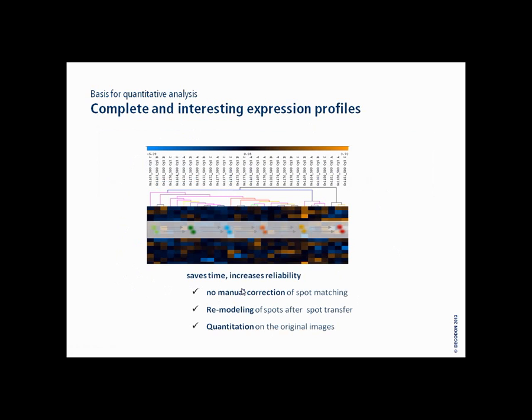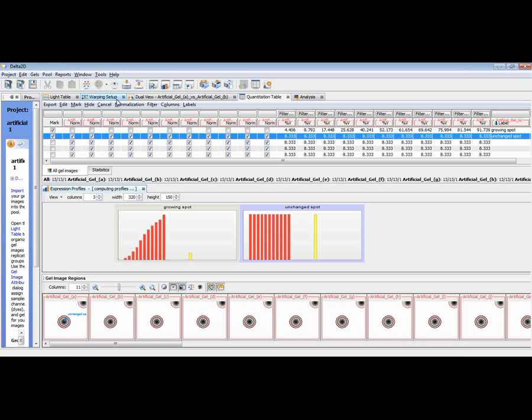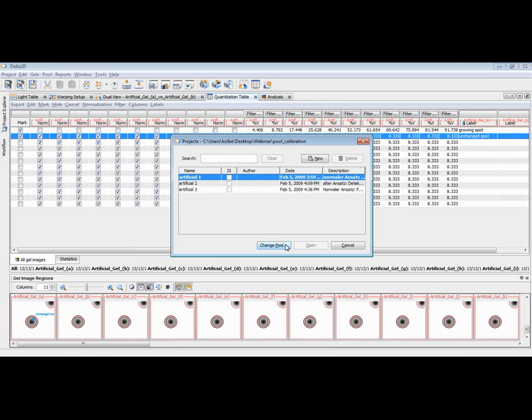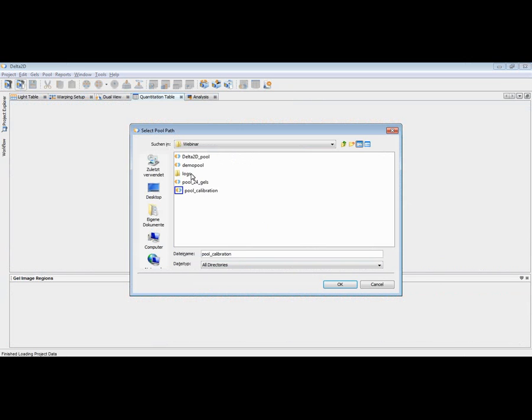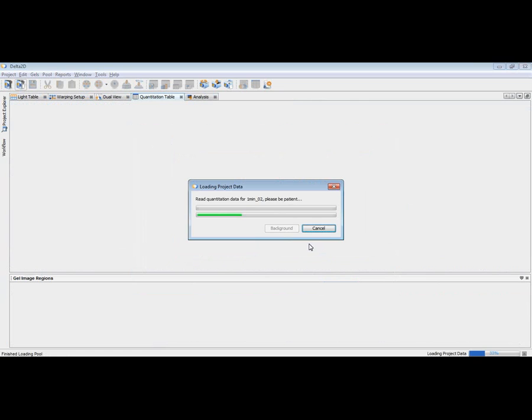Let me show this then in Delta 2D, because then we will see that there are complete and also interesting expression profiles, hopefully, but the interesting ones would be found by using statistical analysis, which is part of another webinar later. Let me show this in Delta 2D. The quantitation table is shown here. Let me double click to increase the size, but let me switch to the demo project again, where we have more data available. Let's go into the demo pool. Open demo project again.